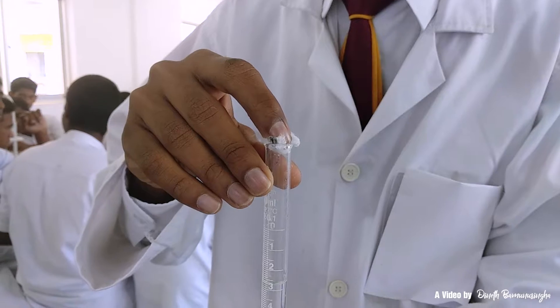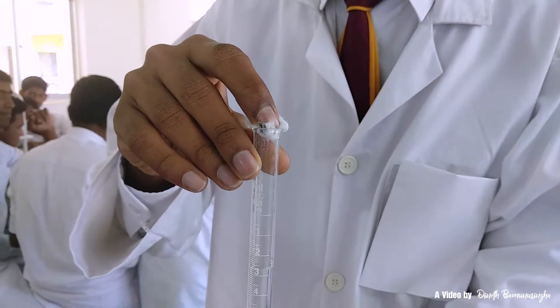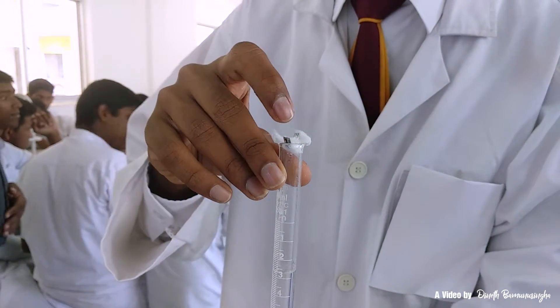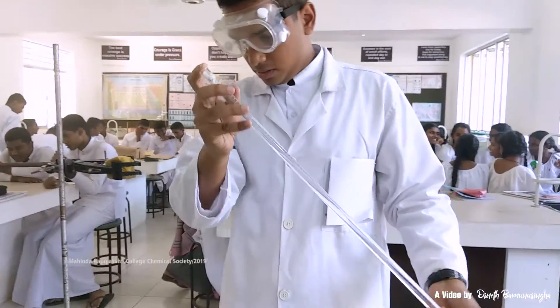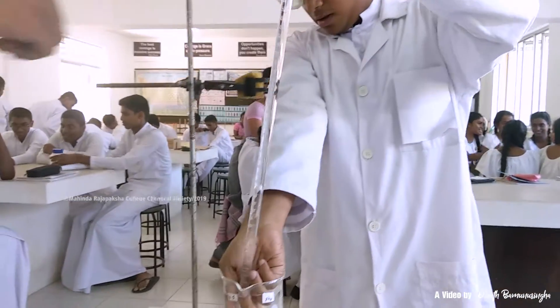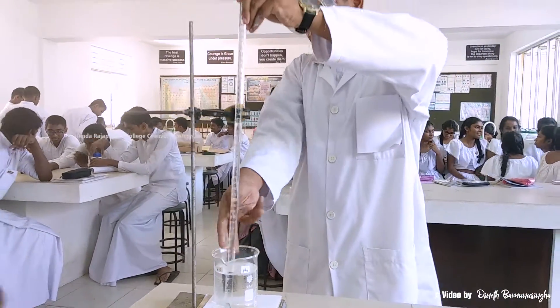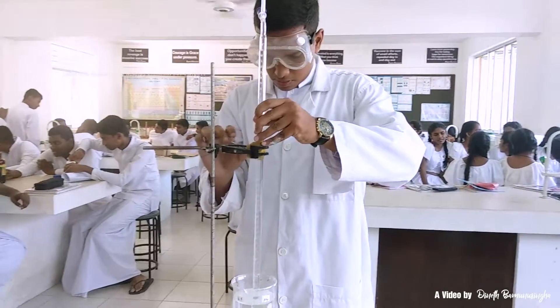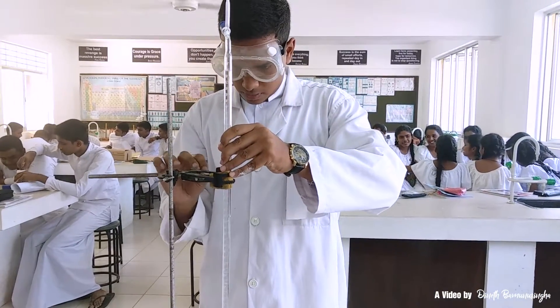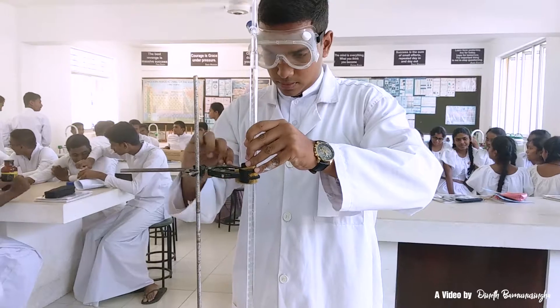Fix the strip of magnesium wrapped in cotton wool to the open end of the burette. Then invert the burette quickly and place the end underwater in the 1-litre beaker filled with water. Clamp the burette on the stand.